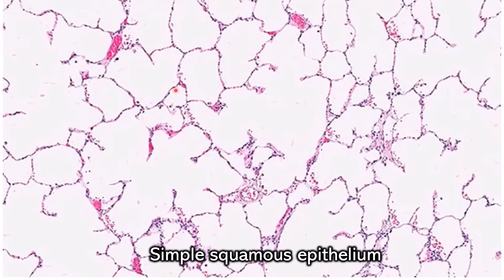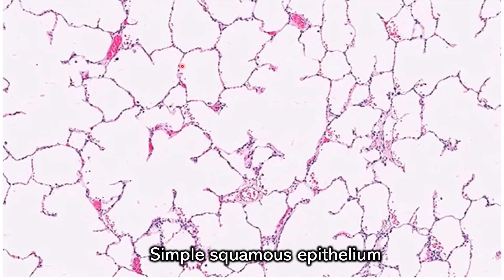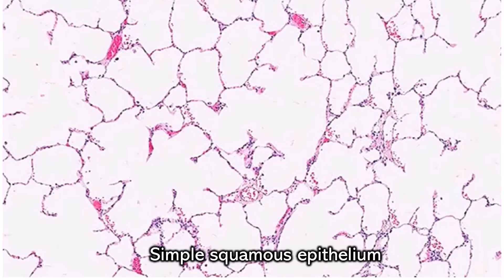If you compare side by side with simple squamous — this is in a lung — it's not perfect little circles; they're kind of irregular circles. And if you need more help, I'm going to make a video specifically just about this.